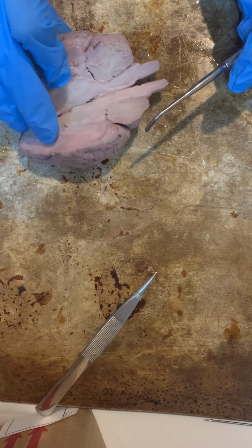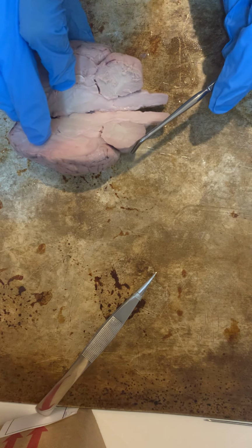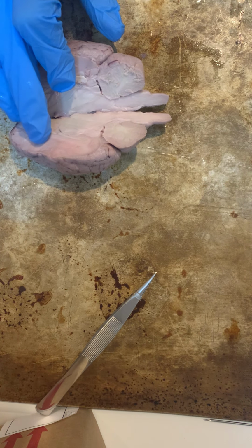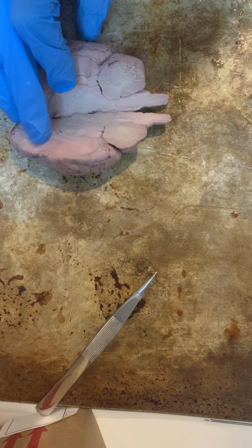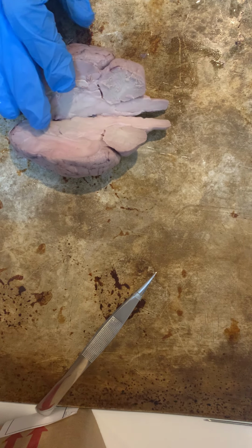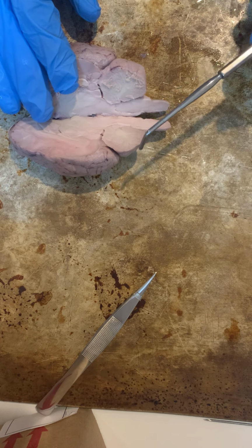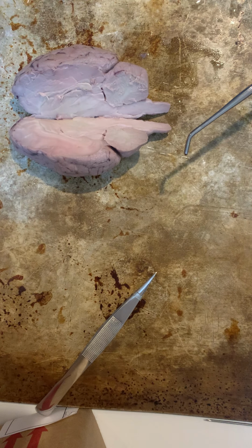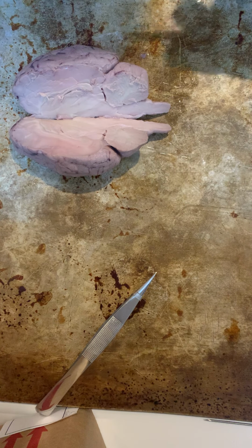So here we have our cerebellum, and this receives sensory information and is also responsible for the regulation of our voluntary motor movements. And within regulation of our voluntary motor movements, it also will coordinate timing and things like that of those movements.